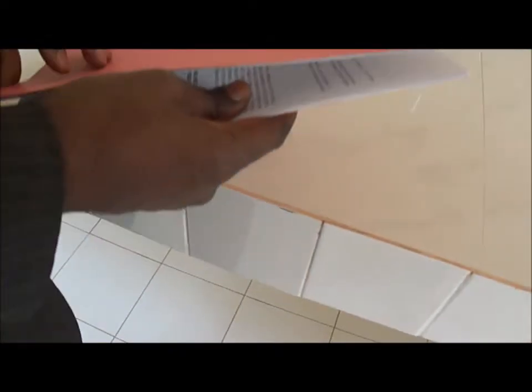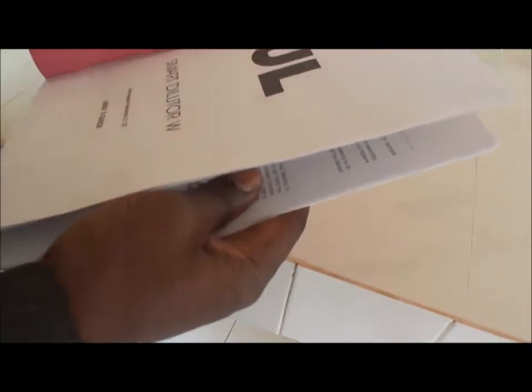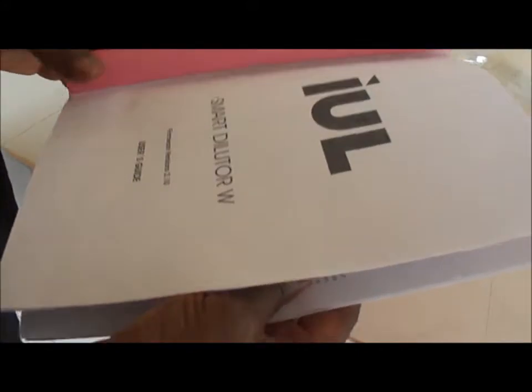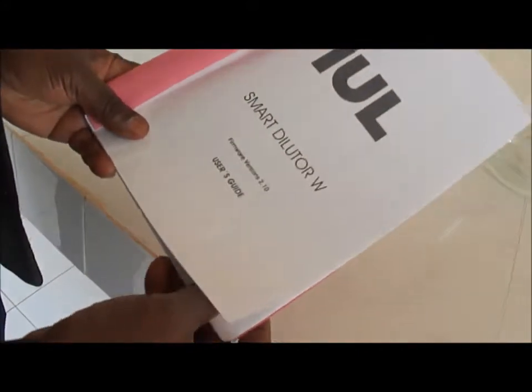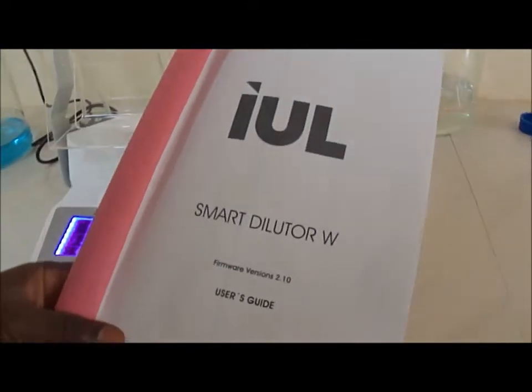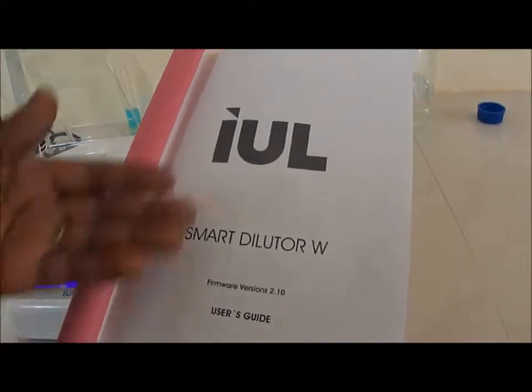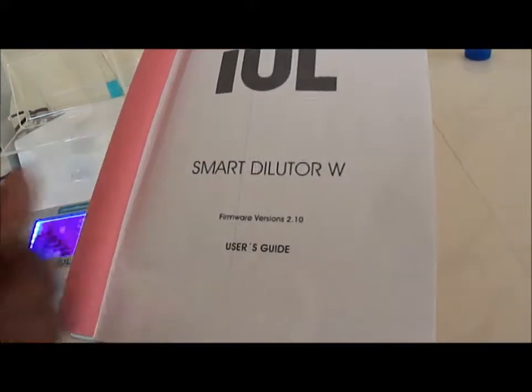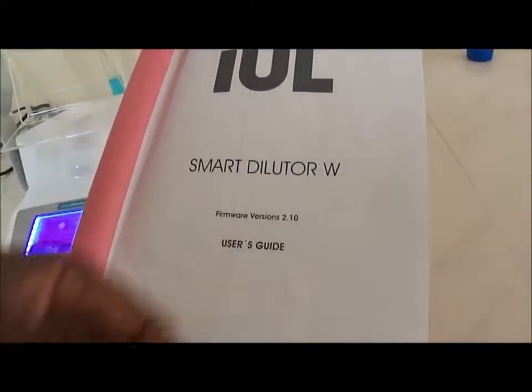Now we will start using the smart dilutor. First of all, one should know that the smart dilutor comes with a CD-ROM from which you get the user guide, smart dilutor W.